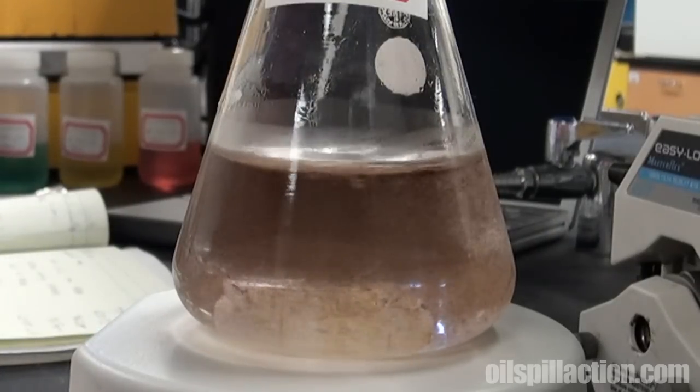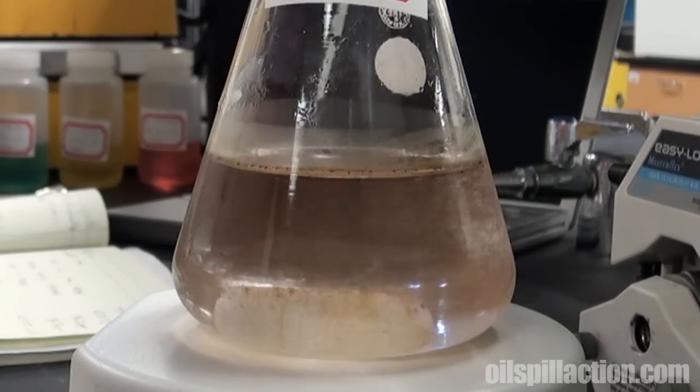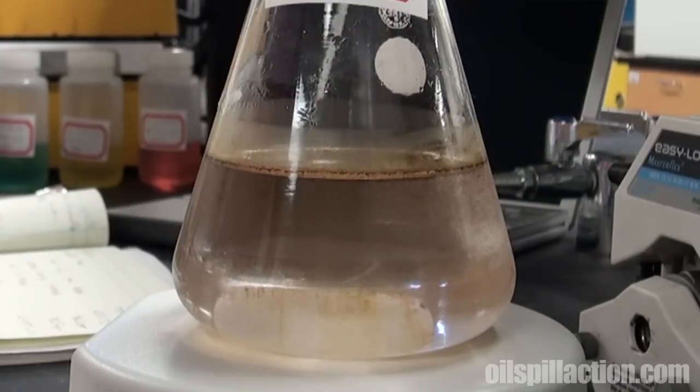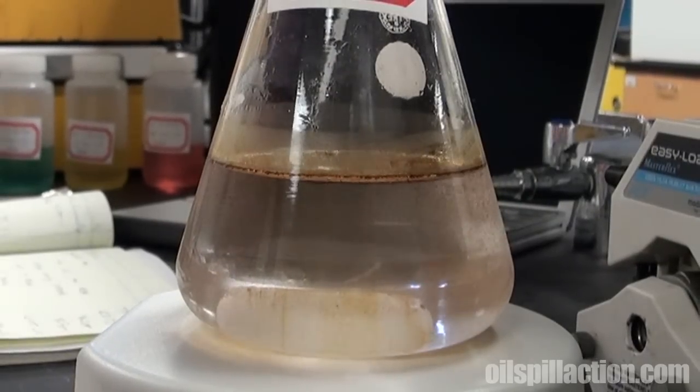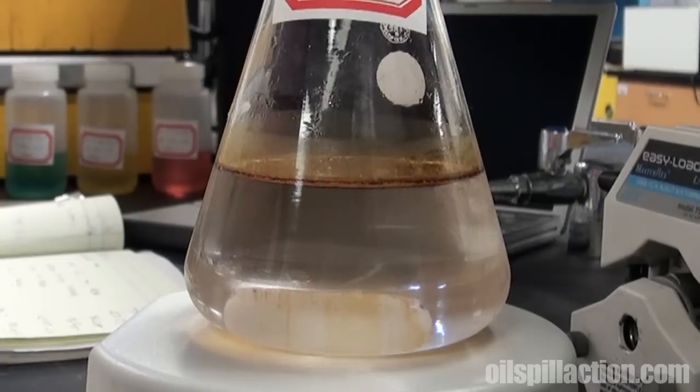Okay, that's 60 seconds. We'll stop the stirrer bar, and very slowly, the oil droplets that are mixed in with the seawater, they make their way to the surface.